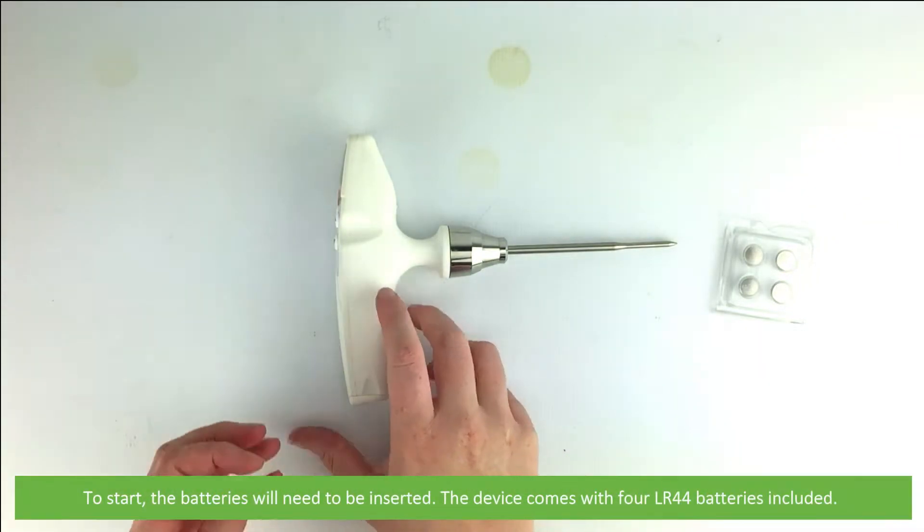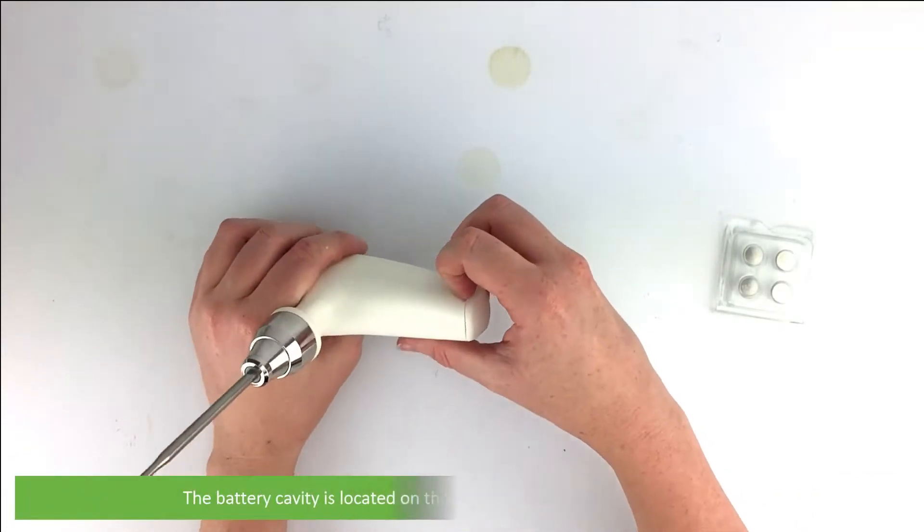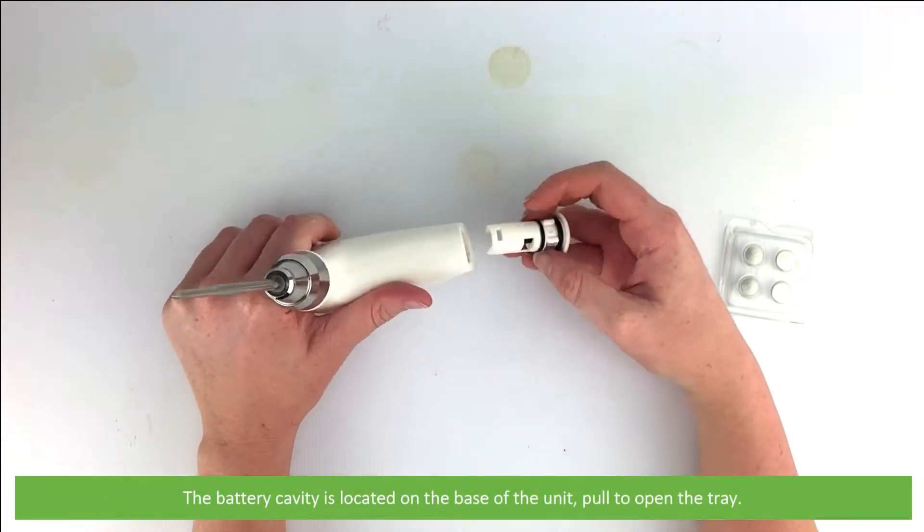To start, the batteries will need to be inserted. The device comes with four LR44 batteries included. The battery cavity is located on the base of the unit. Pull to open the tray.